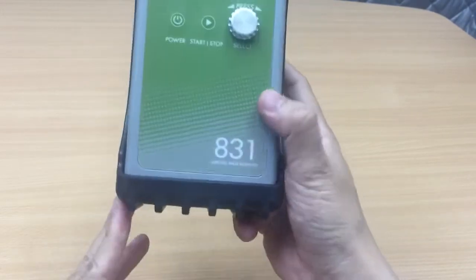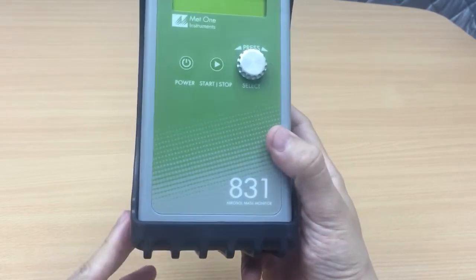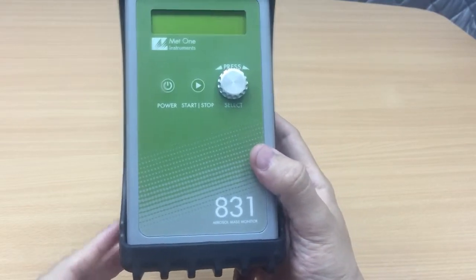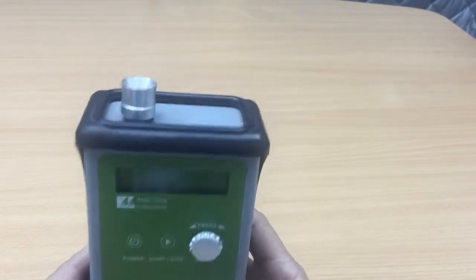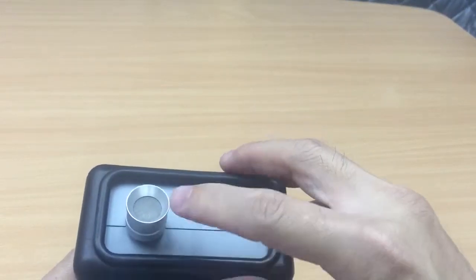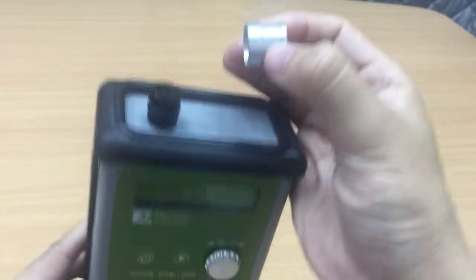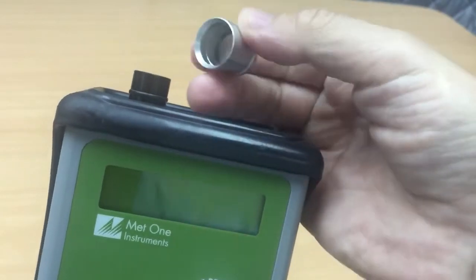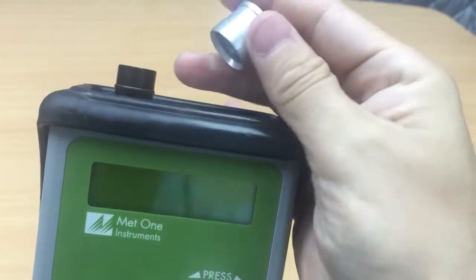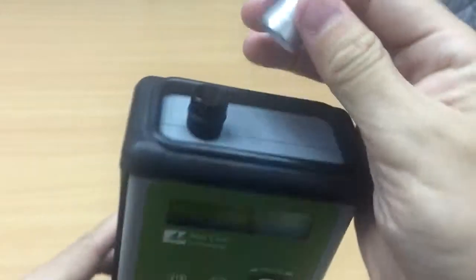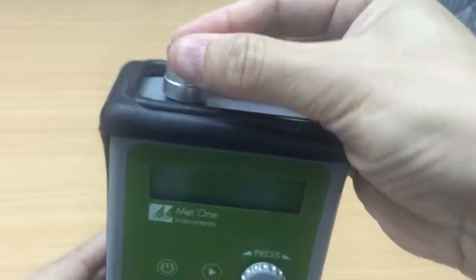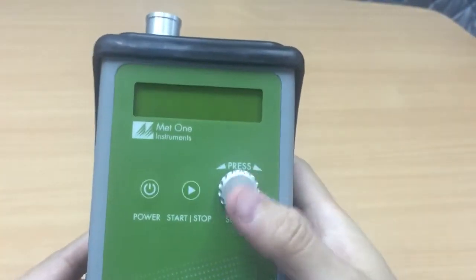How do I use this instrument to see how dusty the air is? Well this is the inlet that is a sieve here that is held together by an O-ring so this sieve is to prevent those bigger particles from getting into the inlet. Now if I were to slot this thing in so I just had to push it in a bit.